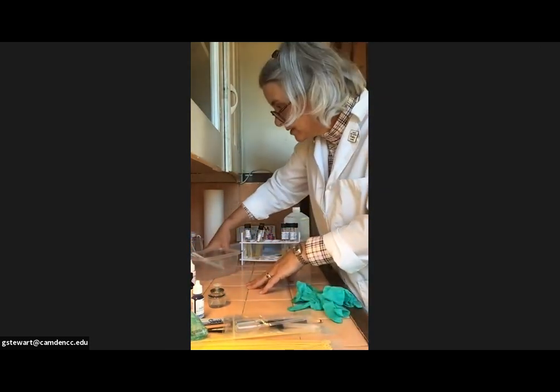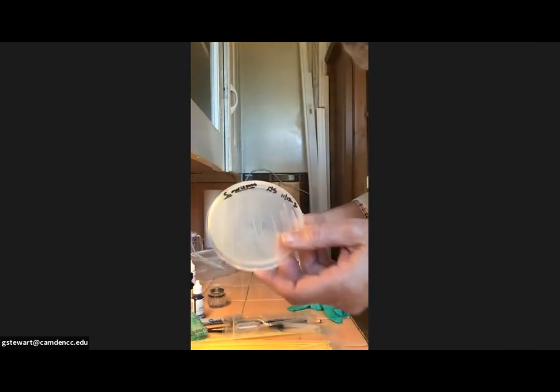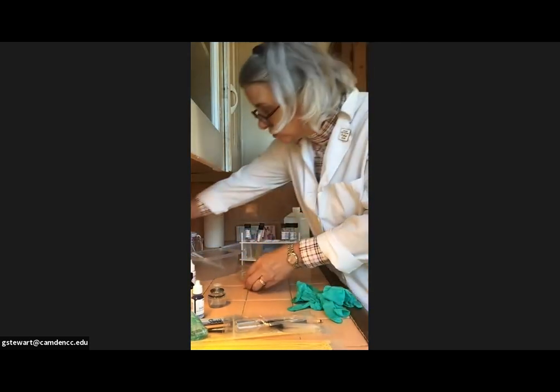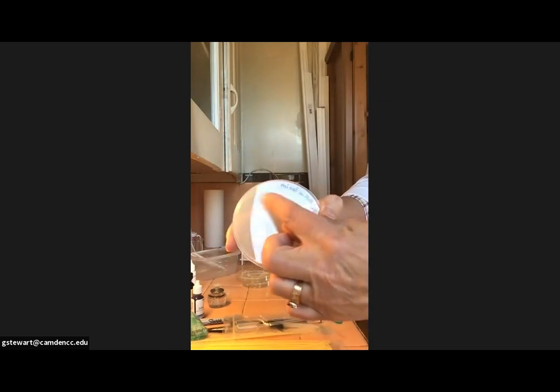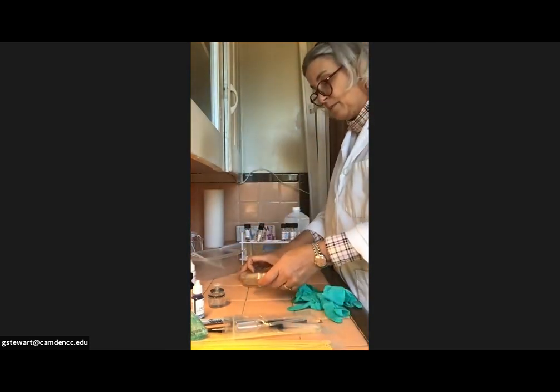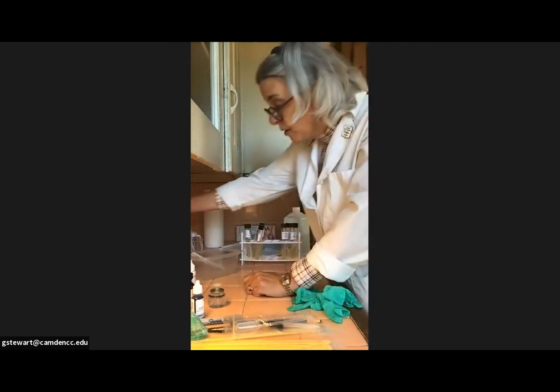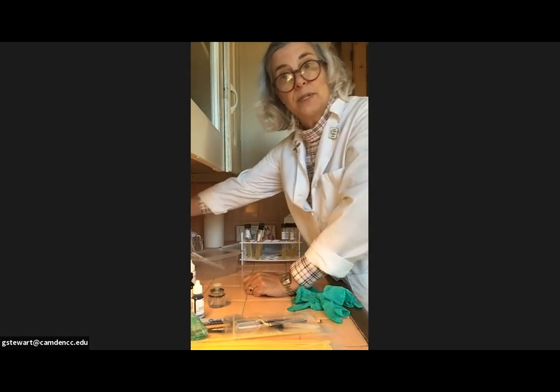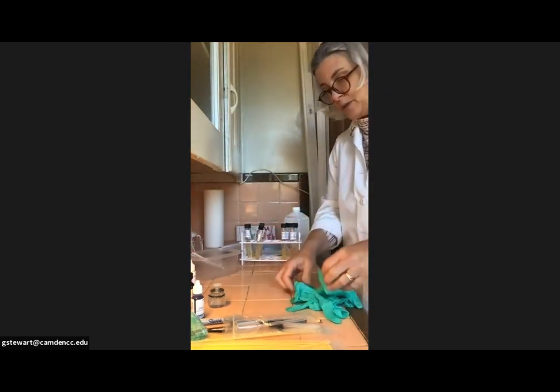And my Petri dishes for both my just streaking Serratia, which I think you can see growing on there, and my mixed cultures, they did not grow enough. My mixed cultures, I only have growth up here in the first quadrant. It's rather cool up here where I'm doing my work. So I'm going to let these just incubate until tomorrow. And I'm probably going to move them to a little bit warmer spot so that I can take a look at them tomorrow and record those results.